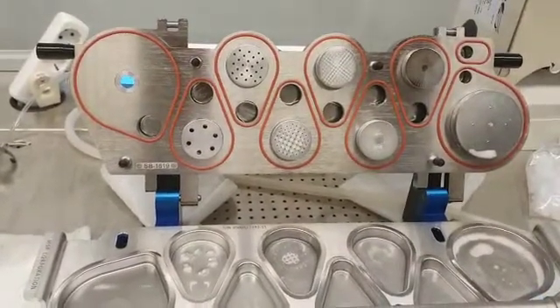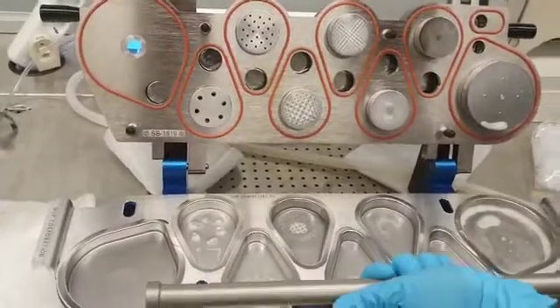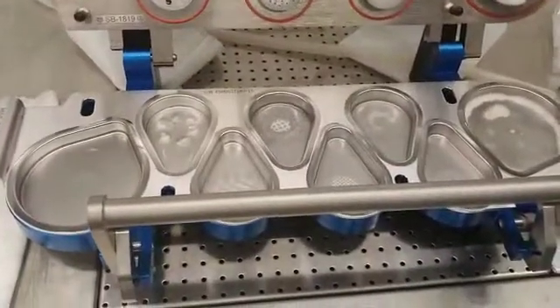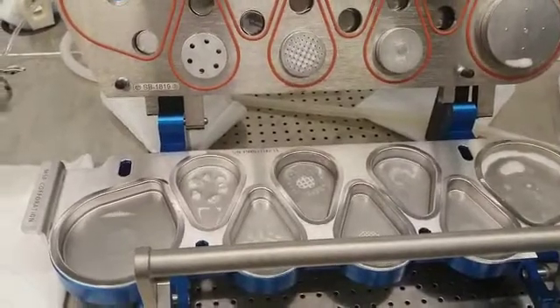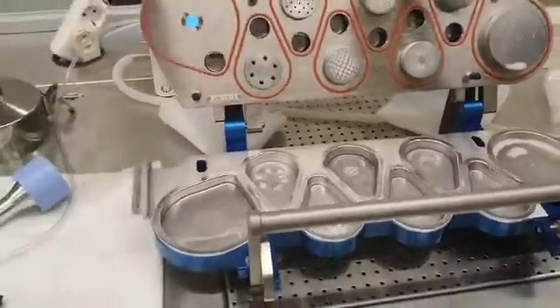Some micron-sized particles end up here. How do you understand how much gets into which part of the lung? It's usually analyzed — we need to collect all the particles from the cups with a proper solution based on the API we have inside the particle, because the API is going to release into that solution. Then after filtration, we run it into the HPLC and see how much of the drug is actually in which stage. Based on that, we can see the efficiency of the system we are working with. So in theory, this delivers the particles, and if there were drugs inside the particles, we would see how much is in each cup — and we know basically where in the lung it will land.